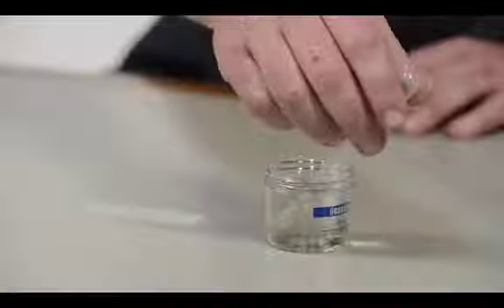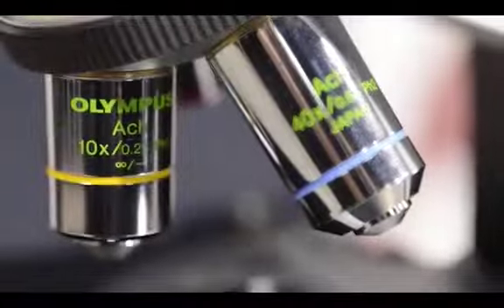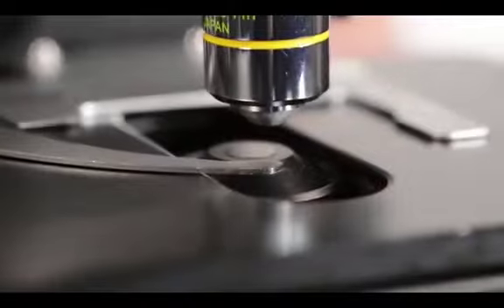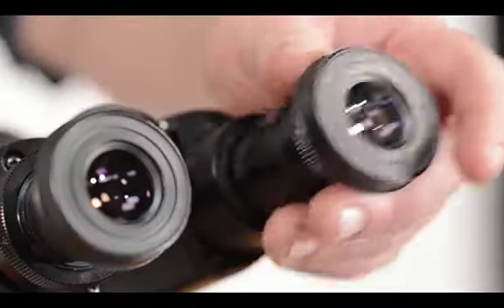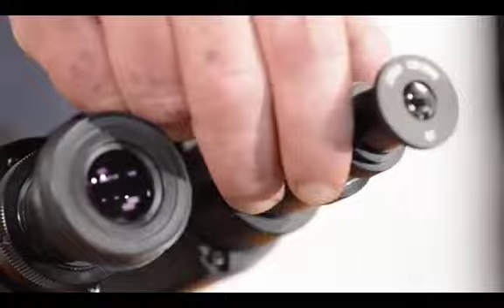Then I will show you how to make a simple slide preparation in order to view the live organisms that you will see in lab 3. Last, I will show you how to solve some typical problems and how to improve your image quality so you can get the best view possible. In the second half of the video, I will give you instructions on how to set up phase contrast microscopy.